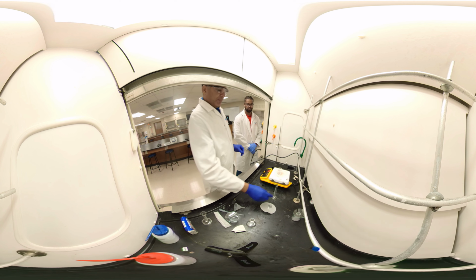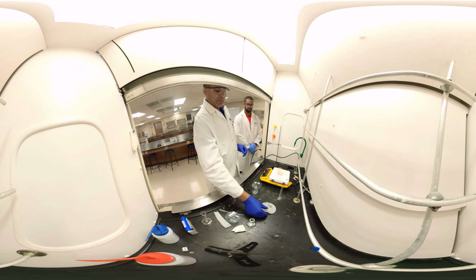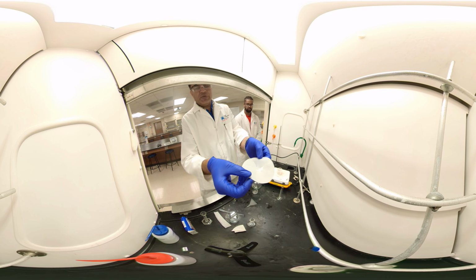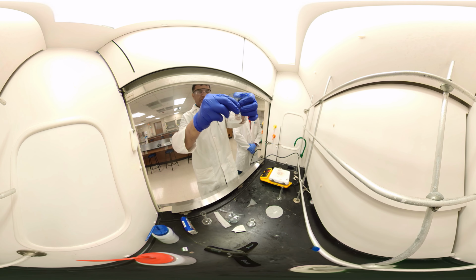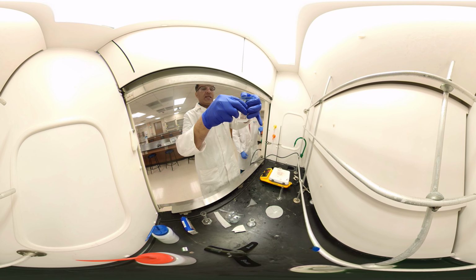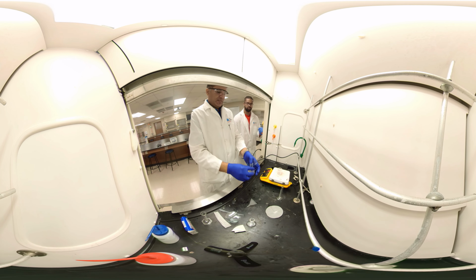fraction. So far, if you are following properly, you understand? So we have the binder here, we dry it, weigh it out, you can see it, okay? Acetaminophen is there. What we have here? Aspirin and caffeine. Both are soluble in organic solvent. How do we separate it?